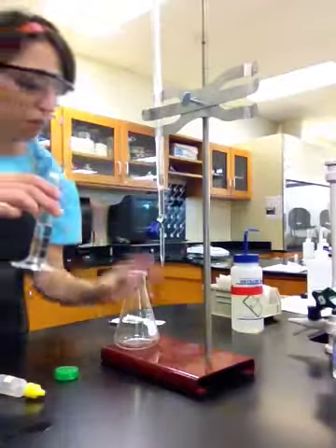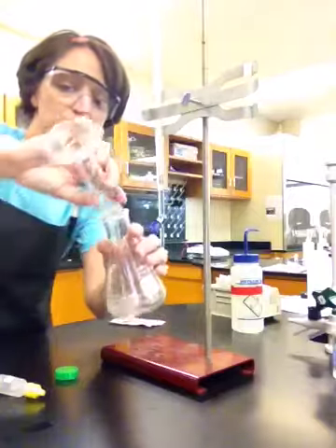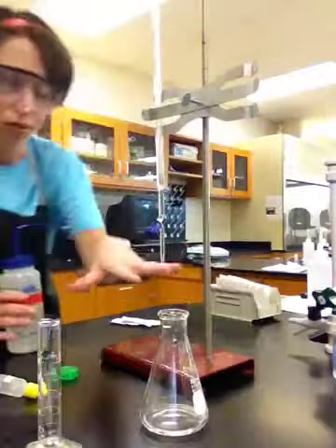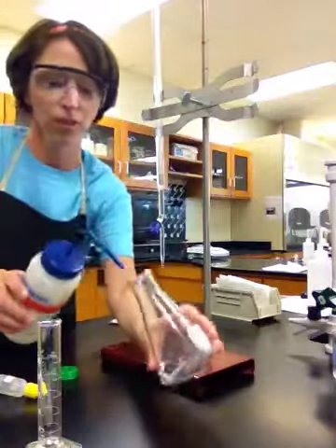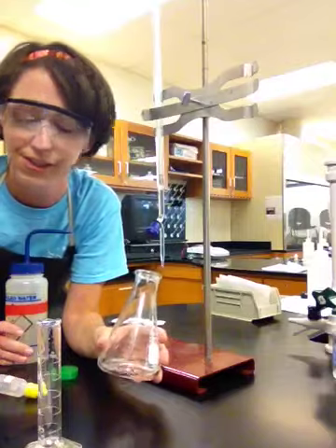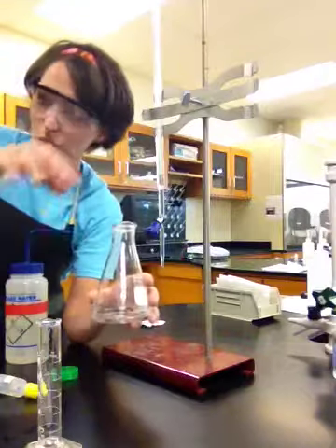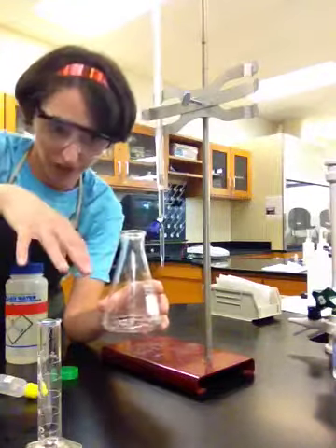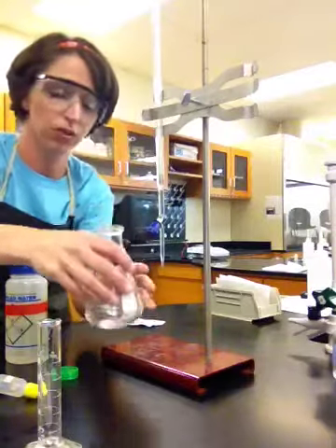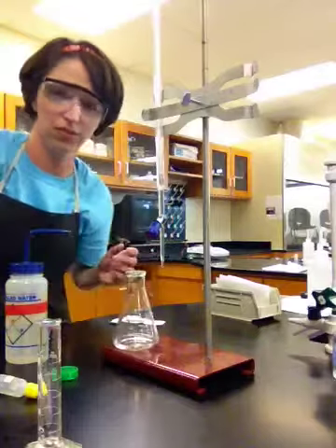All right, so I'm going to go ahead and pour this in my Erlenmeyer flask. And you know what? The great thing is now that the acetic acid is in there, if I add a little distilled water on the sides, is that going to make my data wrong? No, because you know what? As long as the moles of acetic acid are still in there, adding a little water isn't going to change that. The moles are still in there. So a little distilled water helps get some of it off the sides.